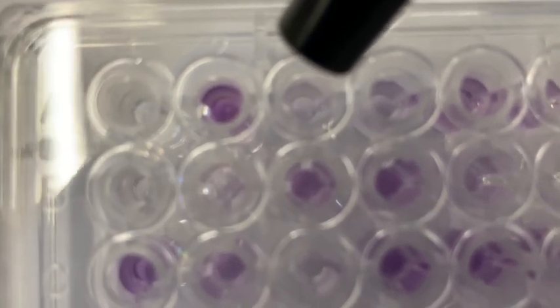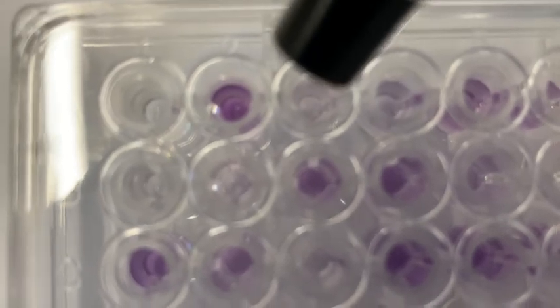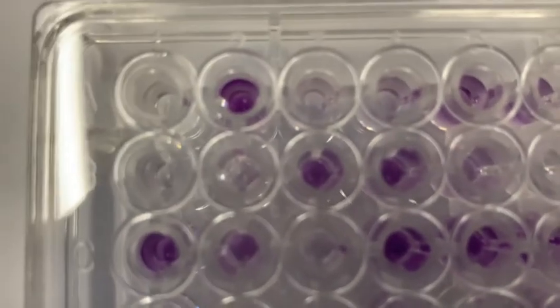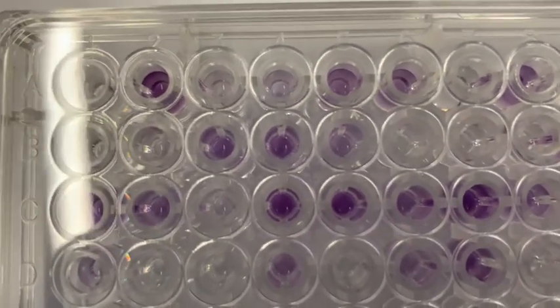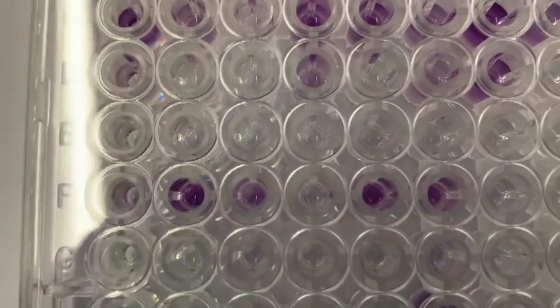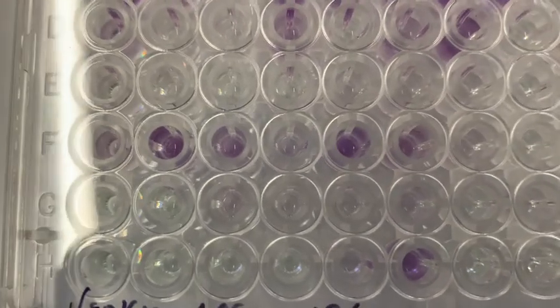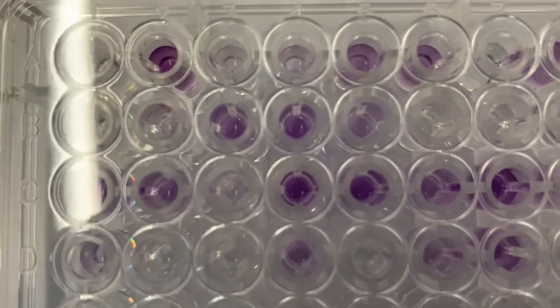There's three things you can give an organism. It can be positive, it can be borderline, or it can be negative, like this one. B1 is negative to me. So you have to go through and decide what you think all of these different wells are telling you. Whether it's really purple, that's obvious. Whether it's really negative, that's obvious. Sometimes it's kind of not so strong.